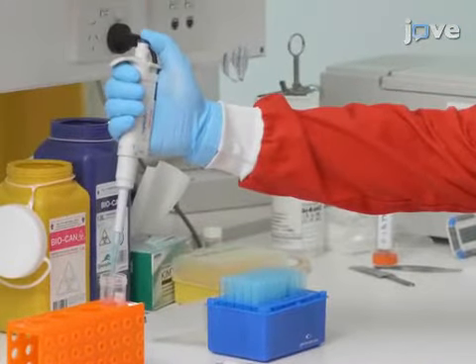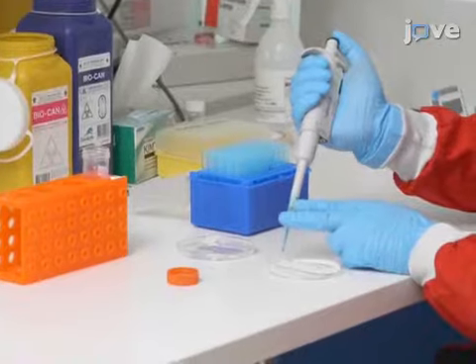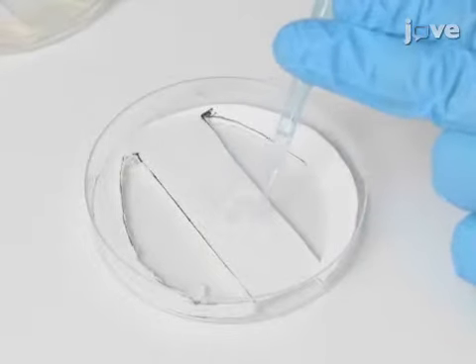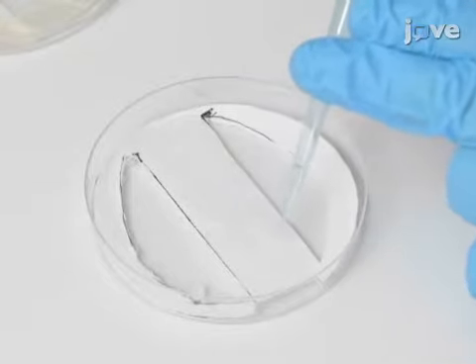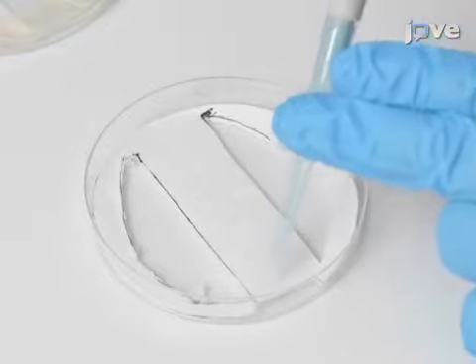Carefully pipette 600 microliters of a solution containing a 1:1 volume for volume mix of 100% acetonitrile and 50 millimolar ammonium bicarbonate onto the blotting paper finger in the bottom part of the petri dish until the finger appears to be evenly wet. Pipetting is critically important because incorrect pipetting will result in the delocalization of your matrix and surface analytes, which will destroy the spatial information contained within your sample.